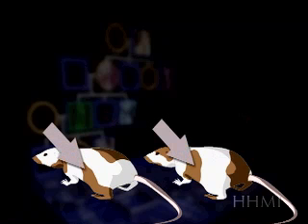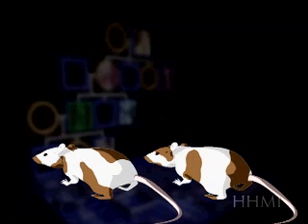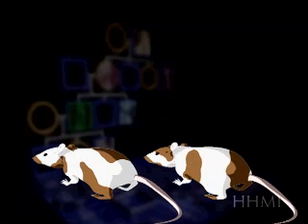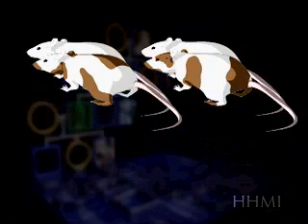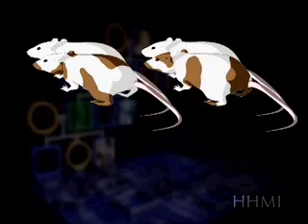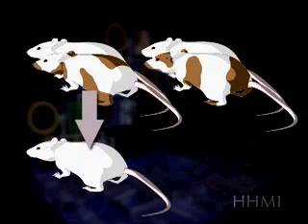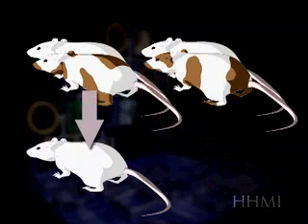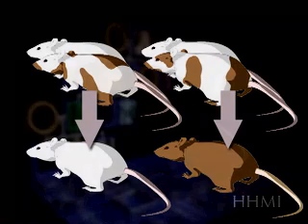Which part of the body comes from which cells is entirely random. To establish a line of mice with a new transgene, it is necessary to find chimeras whose germline cells — that is, sperm or egg cells — have developed from the injected ES cells. This is done by breeding the chimeras with albino mice. In some chimeras, the germline cells are not from the ES cells, and the offspring will be albino. In others, the germline cells are from the ES cells, and the offspring will be brown. These brown mice can be used to found the colony.